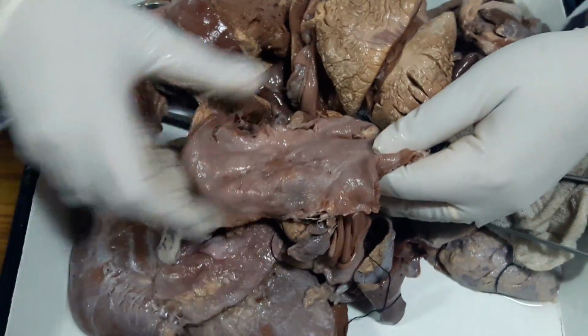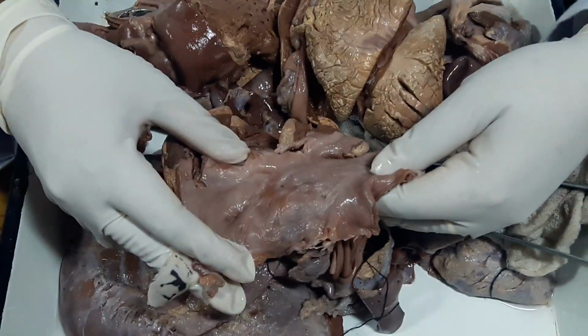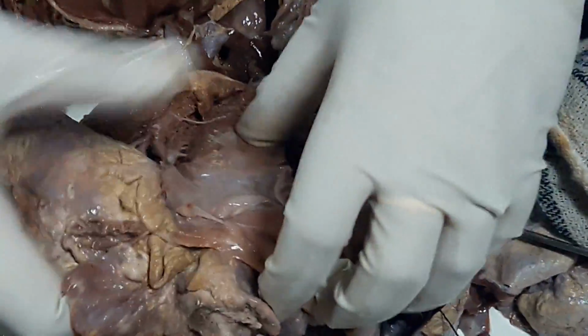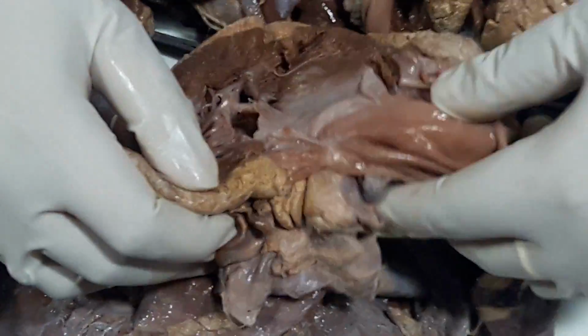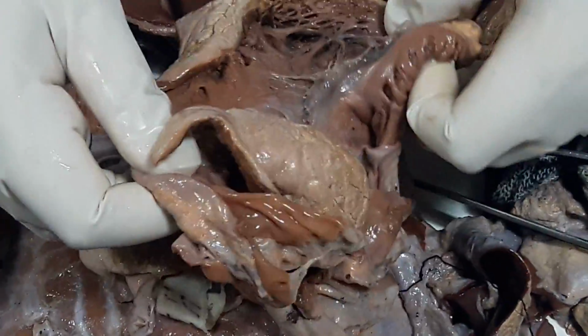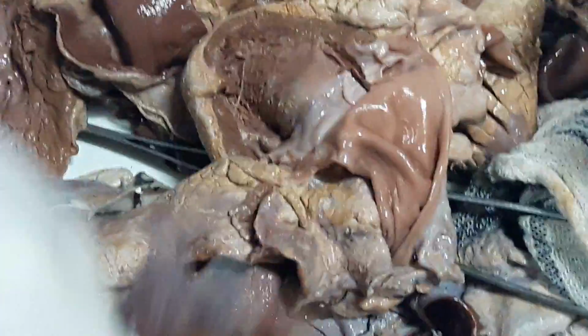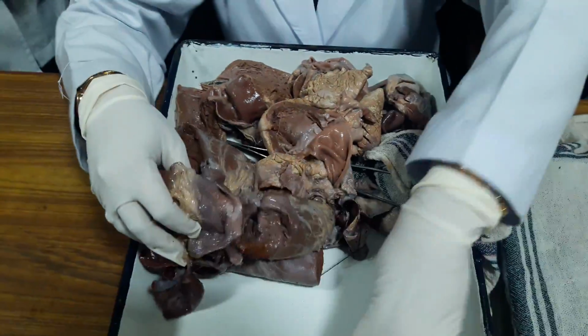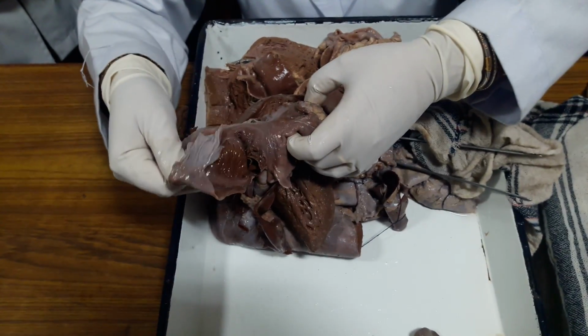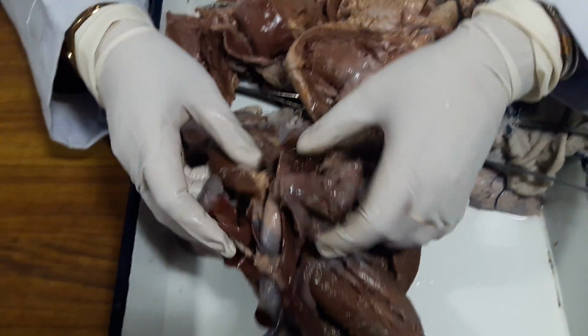Again, this is to show you left atrial enlargement. Mitral valve is showing thickening, chordal shortening and retraction. Okay, the aortic valve is reasonably all right. Section has been taken from here. This is the right side. The small hearts I will show next time. Next practical.